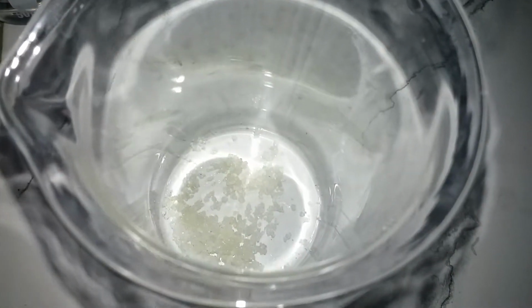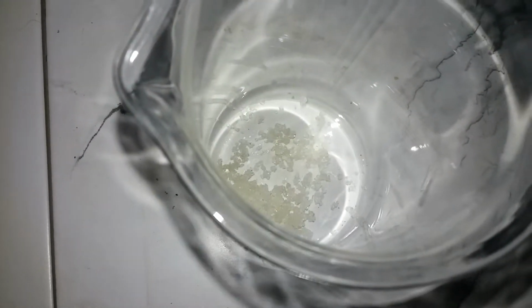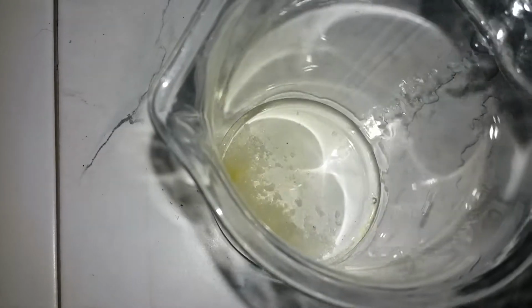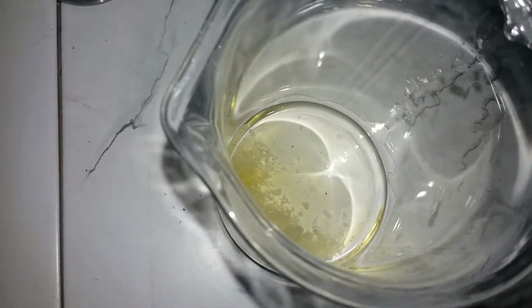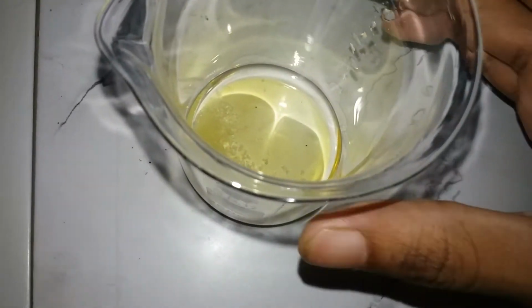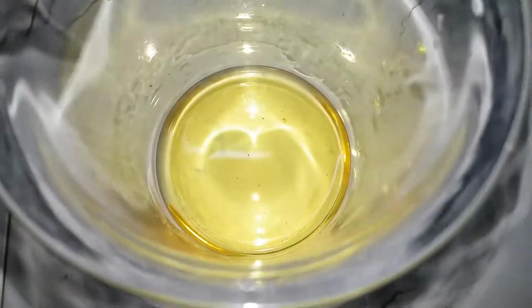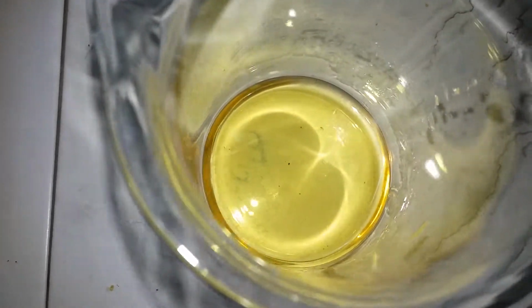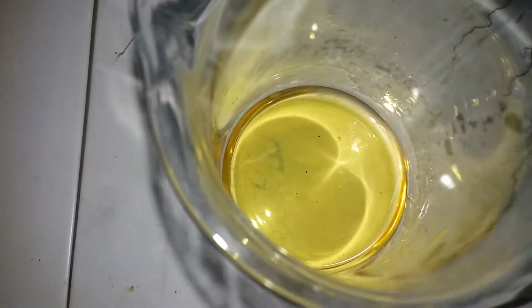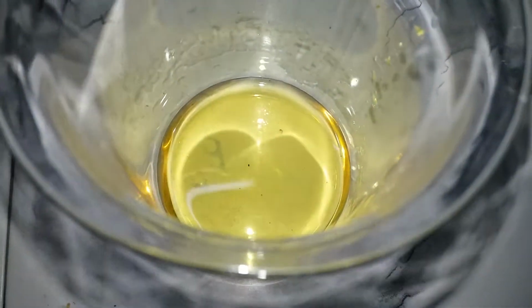Okay. Now to this iodide, I'm gonna add around 15 milliliters of water just to make a solution. And my flask was dirty and I got some hydrogen peroxide in it, so that's not good. Okay, we're gonna swirl it and we're gonna dissolve all of it, and I'm gonna come back when it's all done. Okay, so now all of it has dissolved, and if you have every glassware cleaned, then you should not get this yellow color. Instead, you should get a clear color.